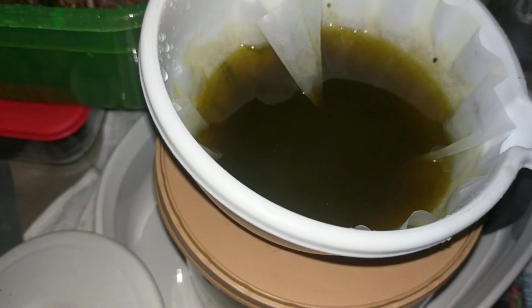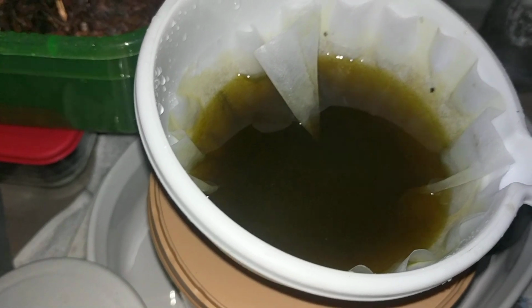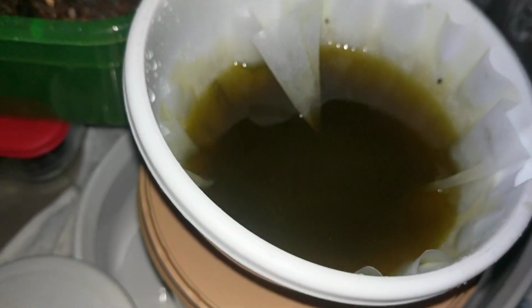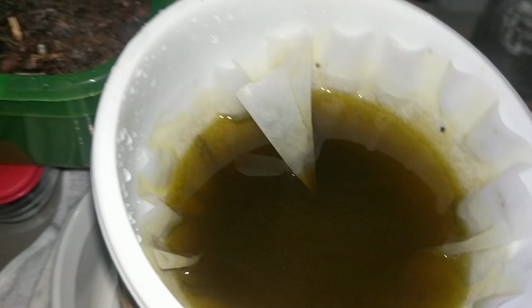And so I went ahead and leached this with HCl and bleach. So came up with a really nice spot. You know what? I got this on. Let's go ahead and do a Stannous so you guys can see it.